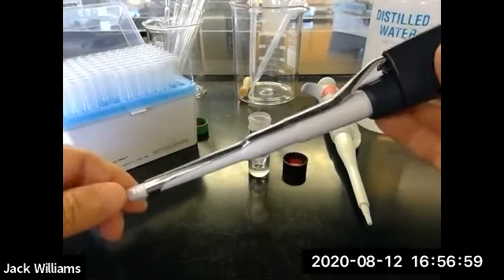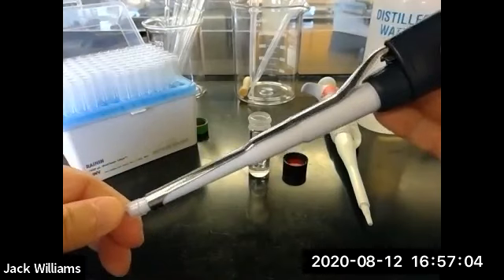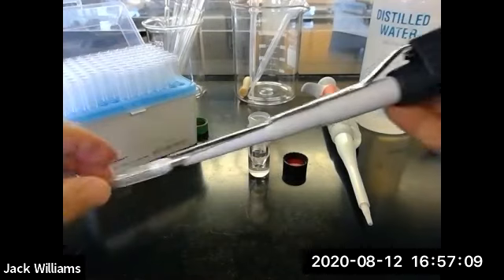So for this particular lab, I would just take my fingers wearing gloves and push this up a little bit. You don't have to jam it in there. Push a little bit so it's secure. See if that doesn't wiggle. All right, so this is set.